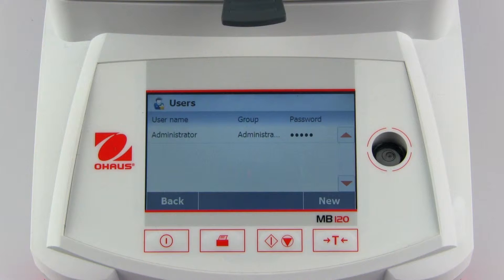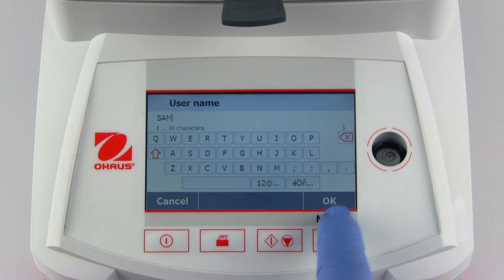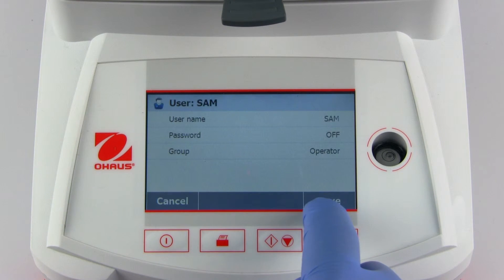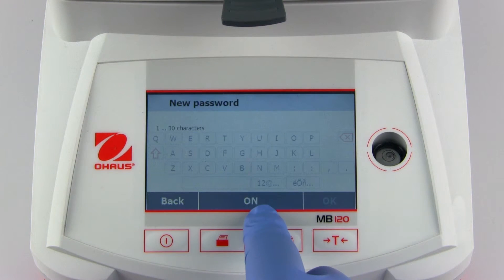To create a supervisor, select new and enter a user name. To assign a password, press password, enable it, and enter a new password.